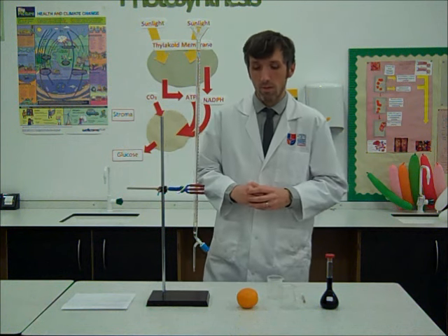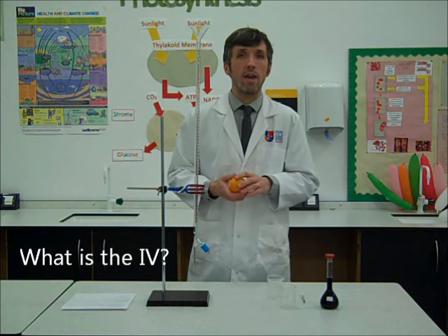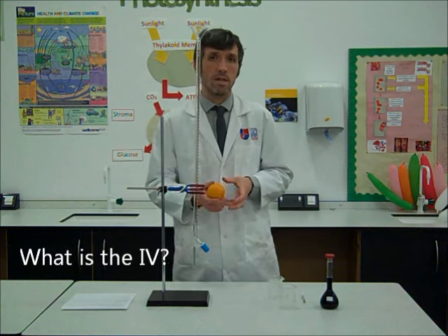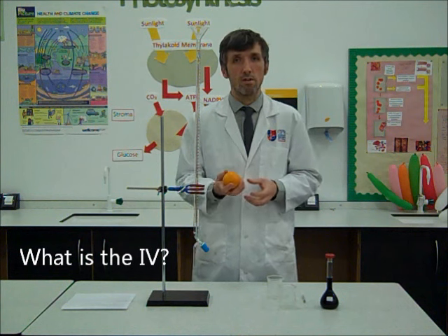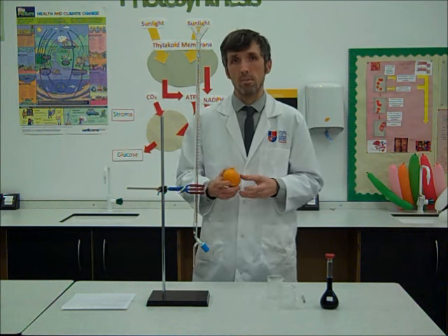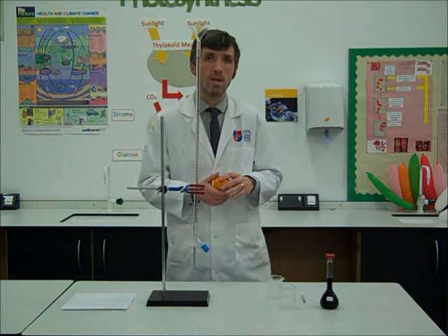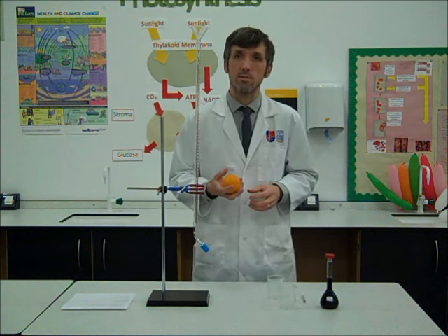For this situation, we're going to imagine that we're looking at two countries, and they've basically claimed that their oranges contain the most vitamin C. We're looking at comparing Spanish oranges with Portuguese oranges. The Spanish have claimed that their oranges contain the most, and the Portuguese have also done that. We're going to check which one effectively has the highest vitamin C content.